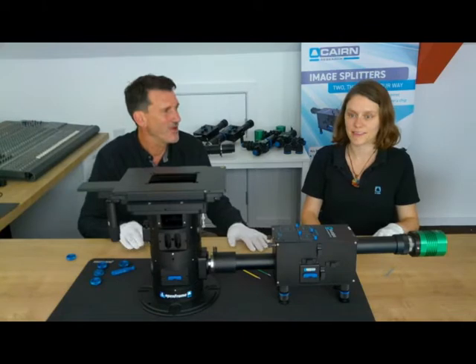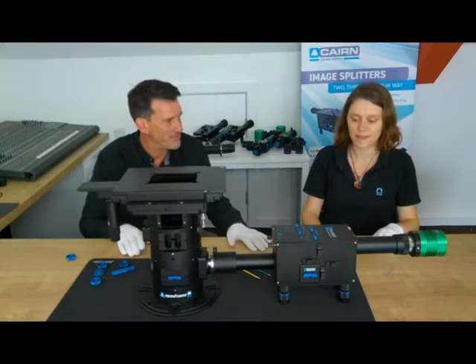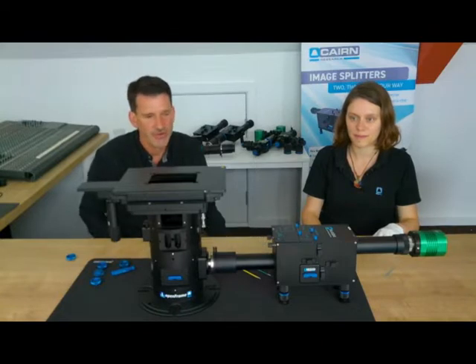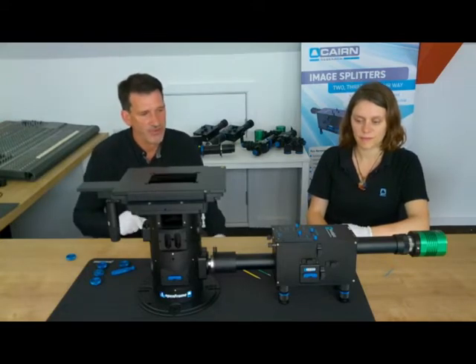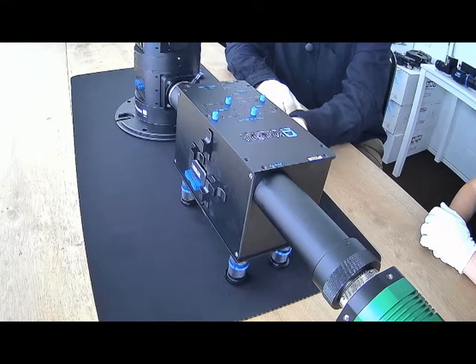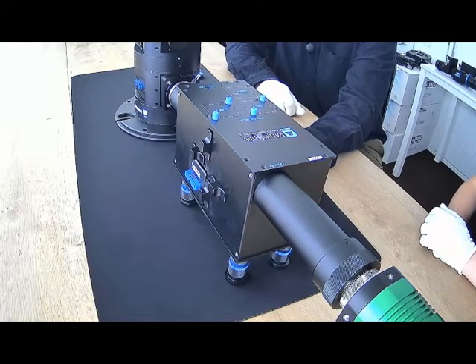And for those of you where 3 colours isn't enough, we're very proud to present the multi-split image splitter, which divides the fluorescence signal or other signal from the microscope into 4 discrete channels. It comprises a set of 3 independent filter cubes, so we can completely configure the separation of the different channels of light using fluorescence, polarisation, or just neutral beam splitters.